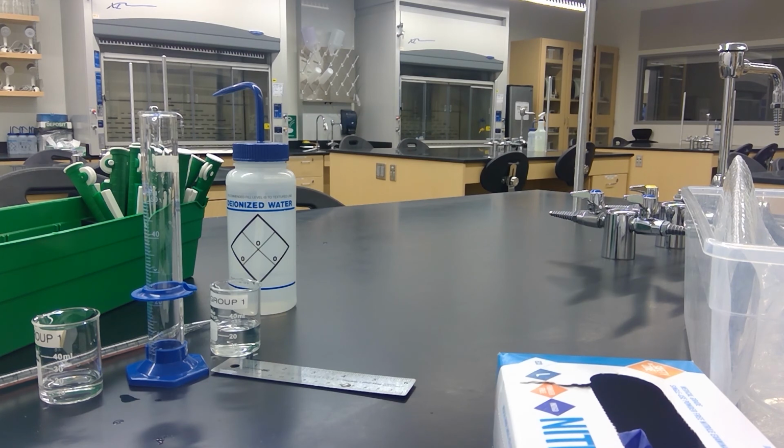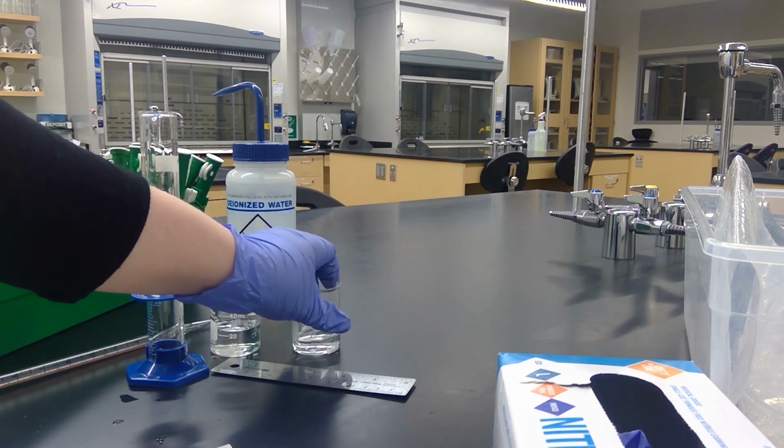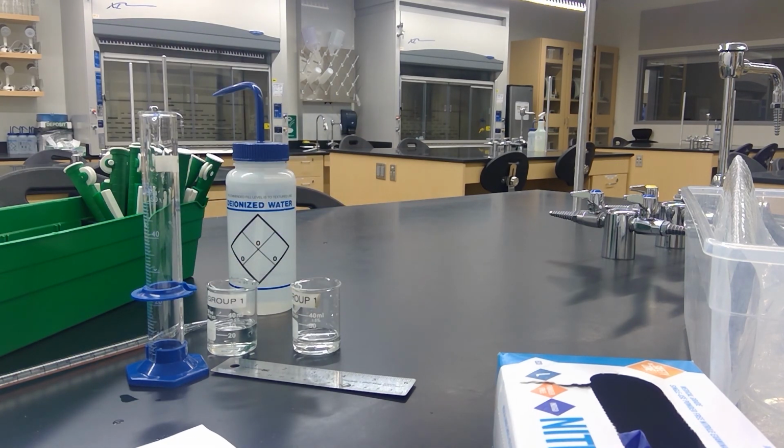Look for the digit of uncertainty and discuss with your lab partner. Note, this measurement will not be identical to the other measurements that you made with either of the two previous tools. So now we're done with that part of the lab, and we'll move on to mass measurements.